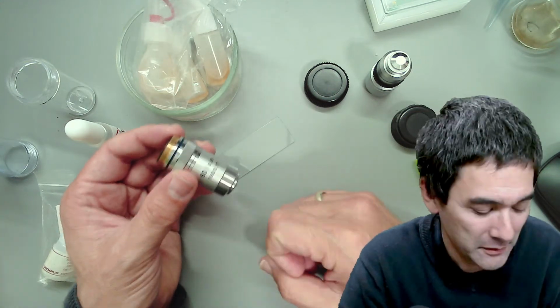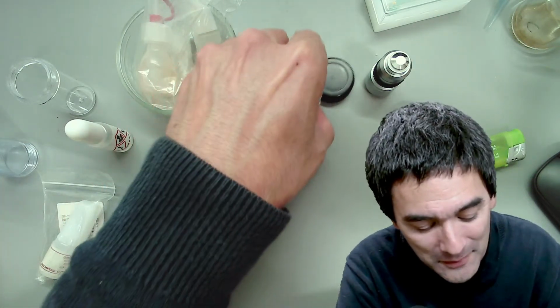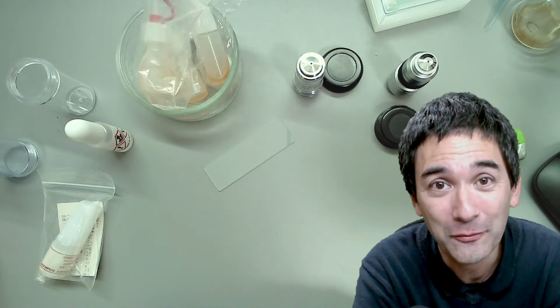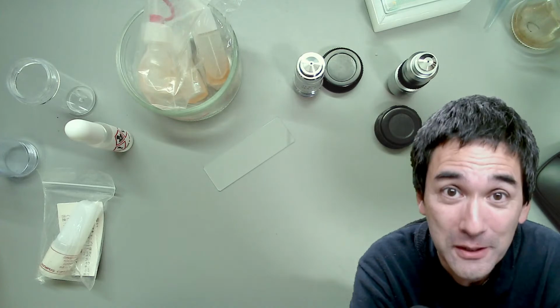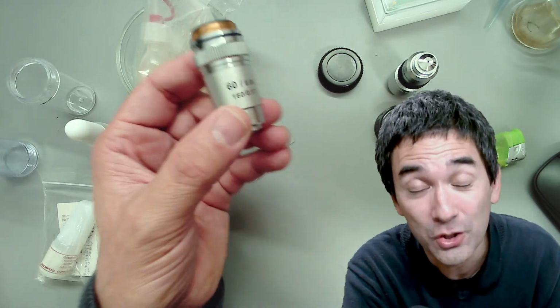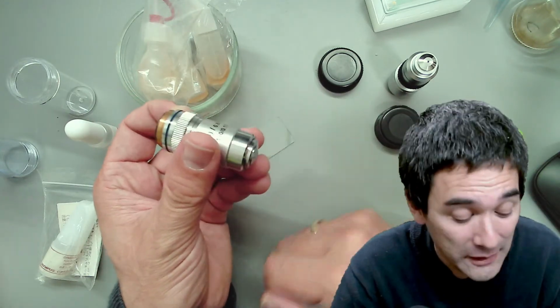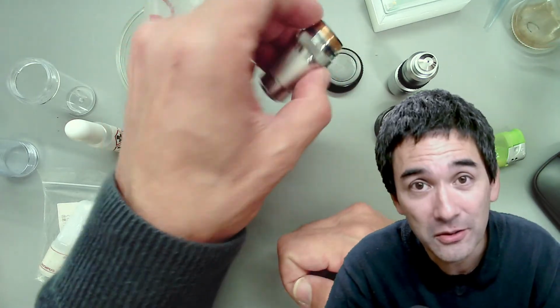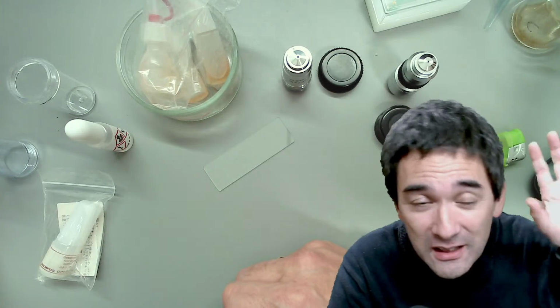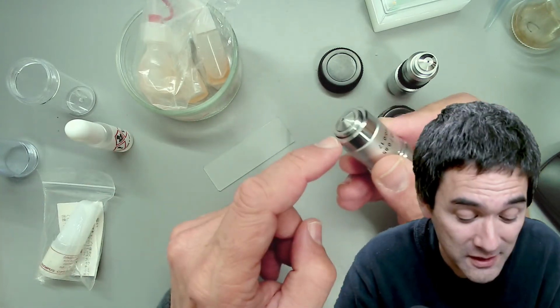Some background story, so that you understand the context a little bit better. I'm a teacher in school, and as a biology teacher I also teach microscopy, and many of the objectives used to be quite dirty, because students accidentally used the non-oil immersion objectives, the dry objectives, with immersion oil. So it got all covered, and then we had to clean it, but there was still some oil left on it. This basically means reduced usability of the objectives, because then the students raise their hands and say, well, I cannot see anything, everything is so blurry. And then I look through it, and of course everything is blurry, because the 40 times objective, the non-oil objective, is all oily, right?